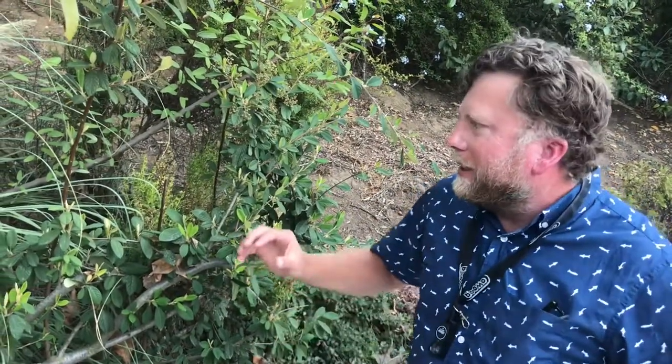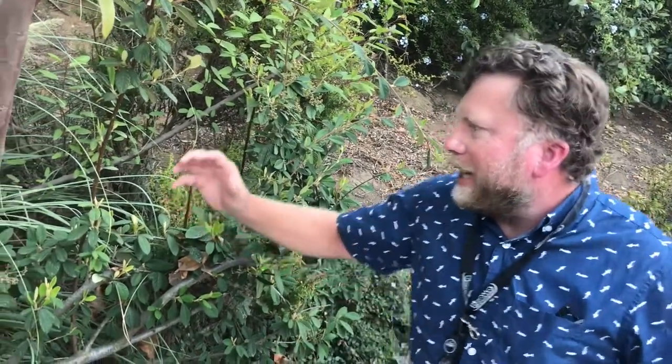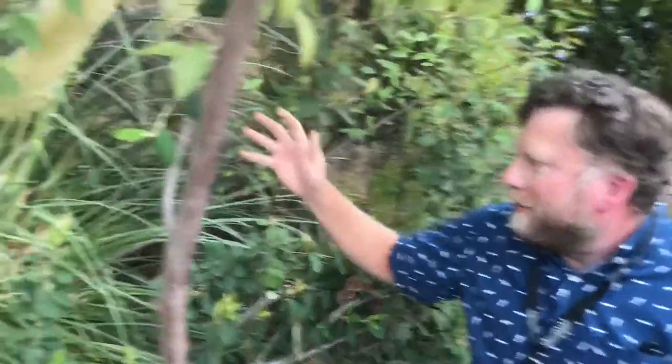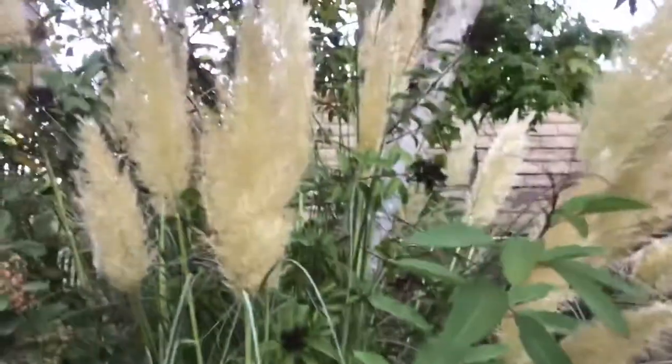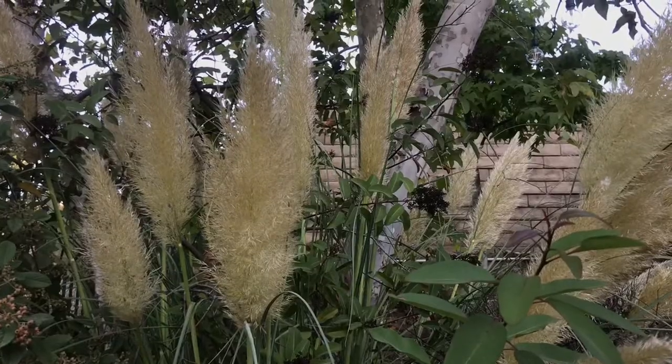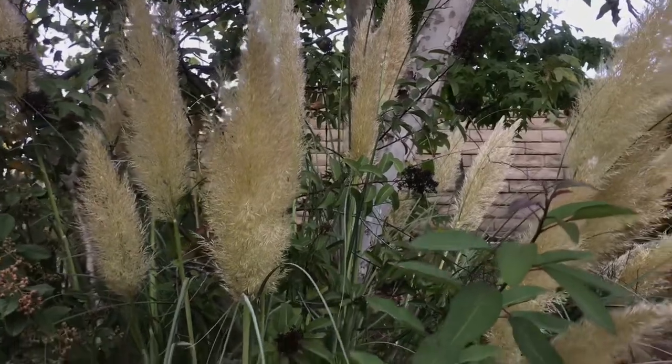We're going to take a herbarium sample of this plant, Cortaderia selloana. A herbarium sample is basically a pressed bit of this plant that gets deposited in a library of other pressed plants — a herbarium.